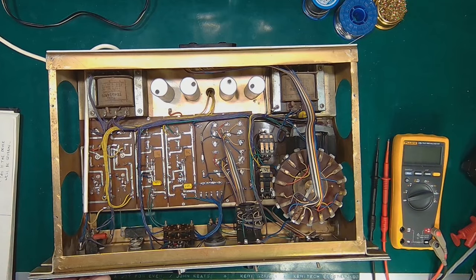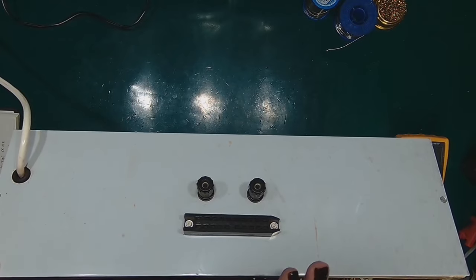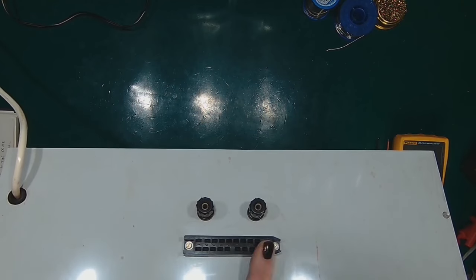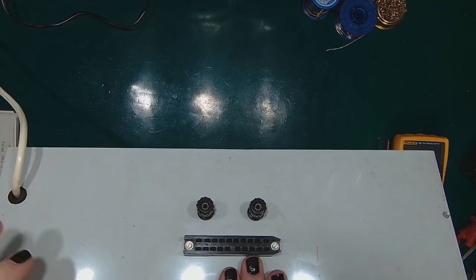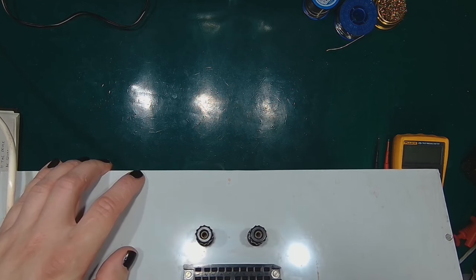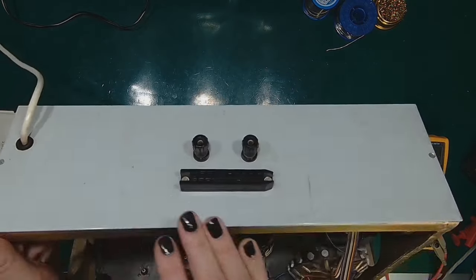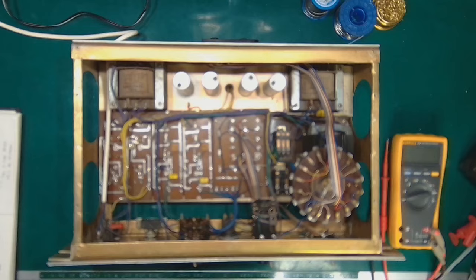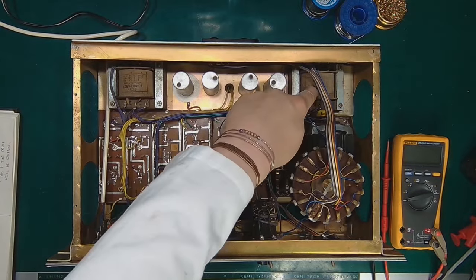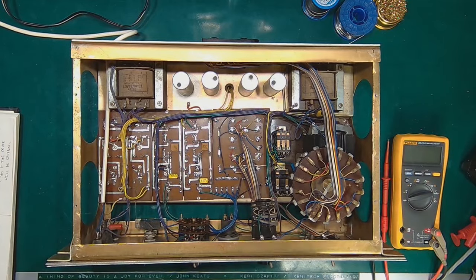And what's on the back panel? The back panel has a two-row 20-pin connector for the wires going to the rods in the Skinner box's floor, and it also has two binding posts coupled directly with the shock voltage after the relay and before the distribution switch.